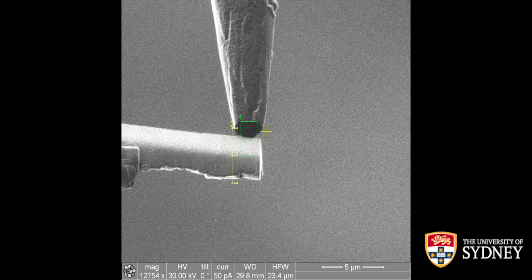One thing then, when you finish deposition, I tend to just let the machine automatically switch over to the cutting pattern, which is the yellow one here, and cut off the lift-out piece from the bar. The one thing that you have to make sure though is that there is enough time for the machine to pump away all the precursor gas before it starts cutting, because otherwise it will not actually start cutting.